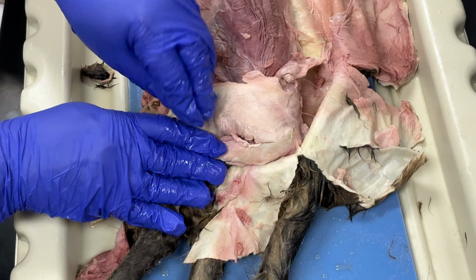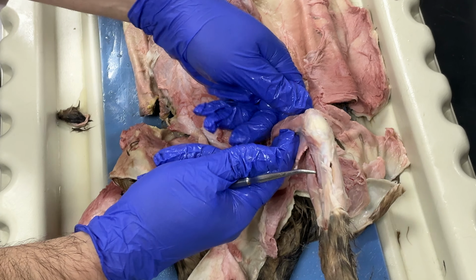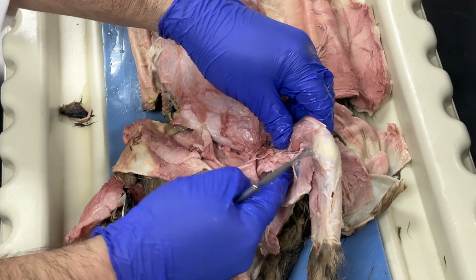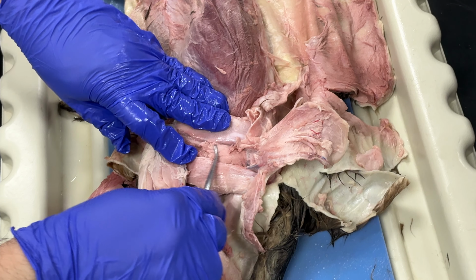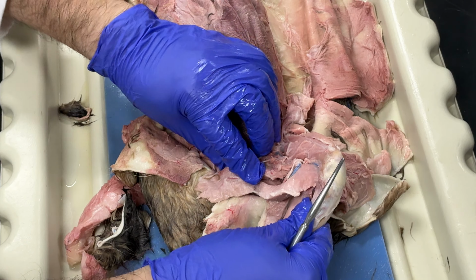Over here, this is my vastus medialis, rectus femoris, vastus medialis, okay? Adductor femoris, this muscle is the same one we see over here, the adductor femoris. And then we have our semimembranosus, and then under that, which was cut, my semitendinosus, okay?